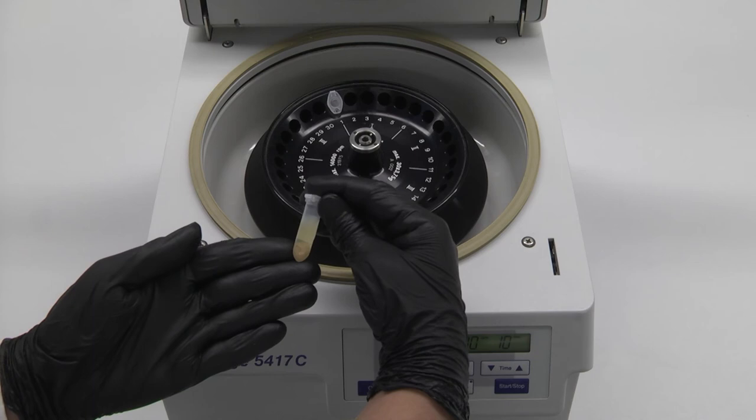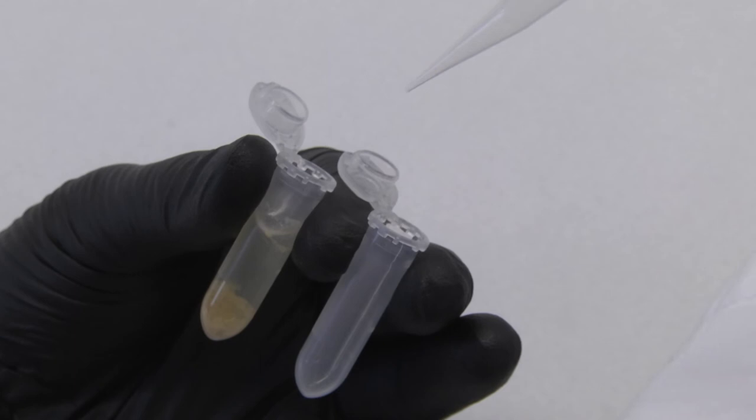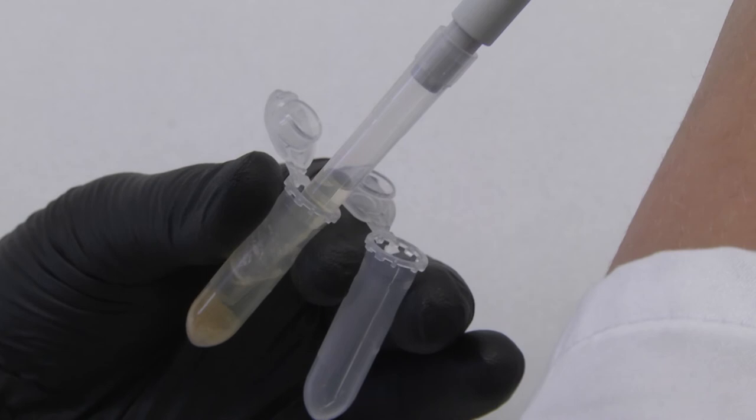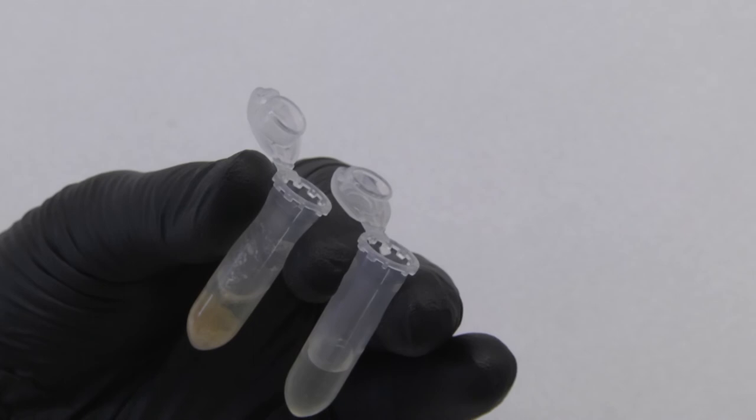The supernatant of the sample should be clear and transparent. If not, filter the supernatant. It is also advisable to transfer the supernatant to a clean vial. The supernatant is now stable for up to four weeks.